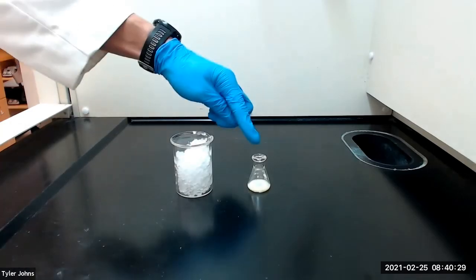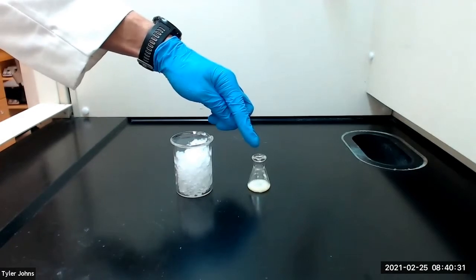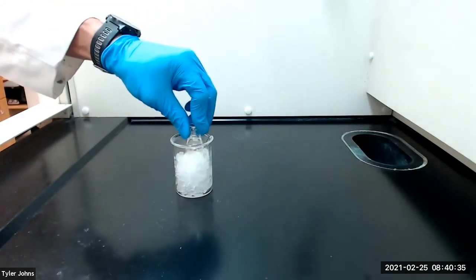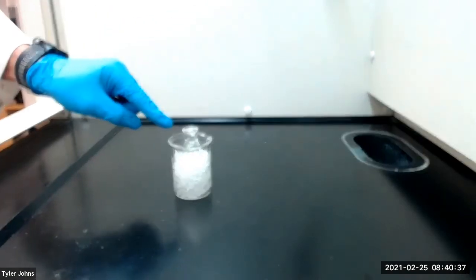After the flask has cooled to room temperature and crystallization has been induced, we'll place the flask in an ice bath for 15 minutes to complete crystallization.